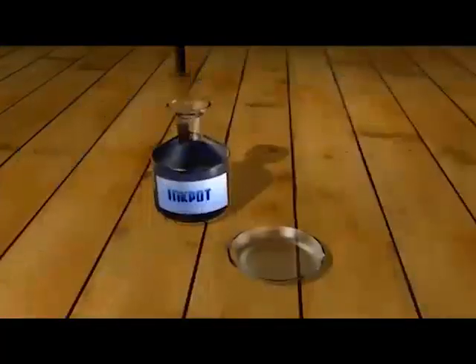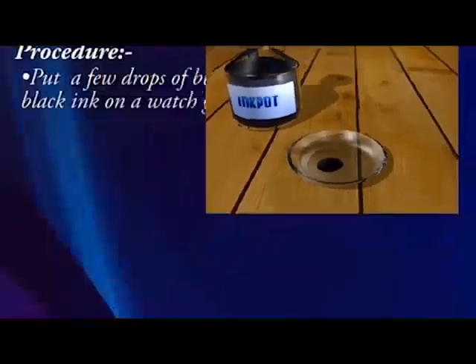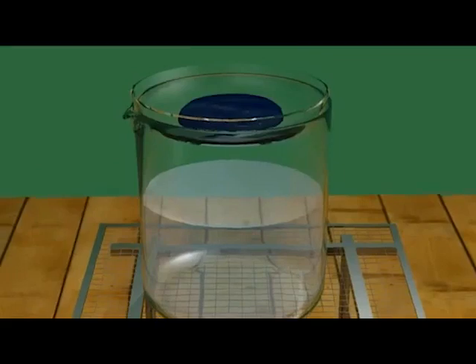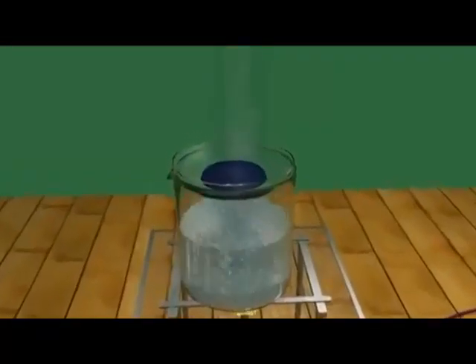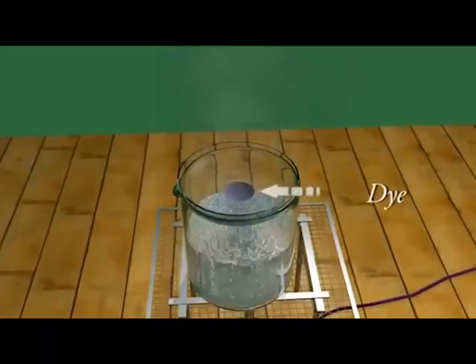First, put a few drops of blue or black colored ink on a watch glass. Now, place this watch glass on the mouth of a beaker half filled with water. And then, heat the water in the beaker. The steam thus formed will heat up the ink. The water present in the ink evaporates and ultimately a blue or black residue is left on the watch glass. This is the dye.